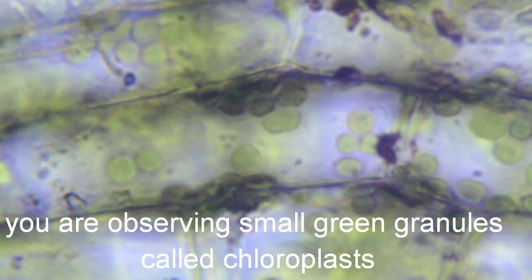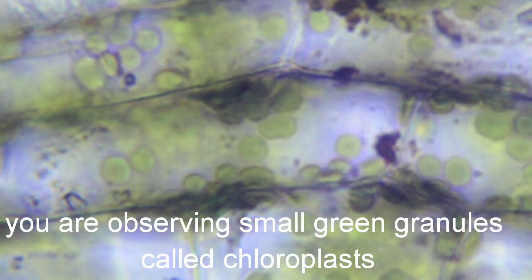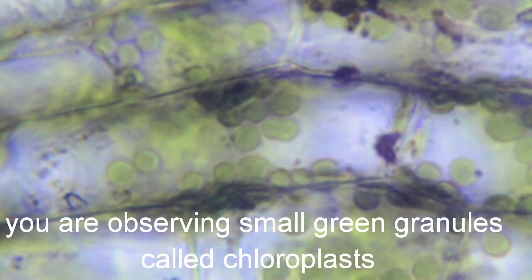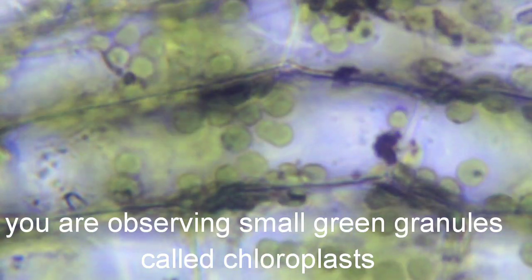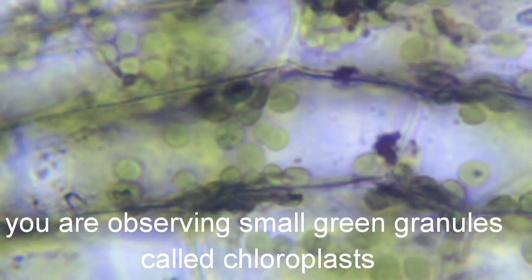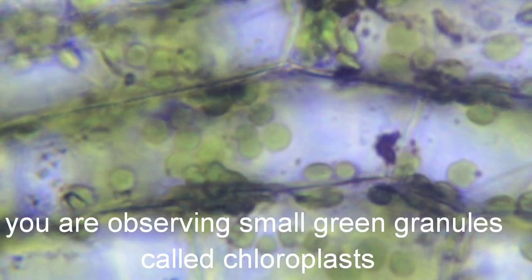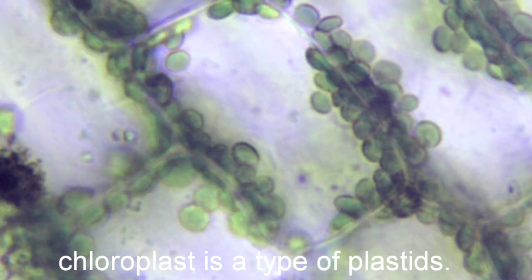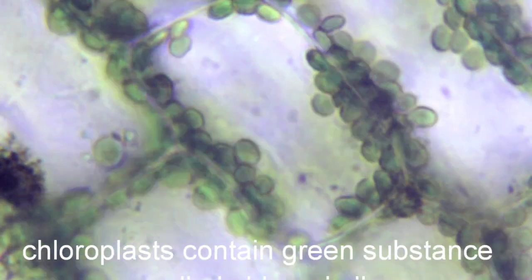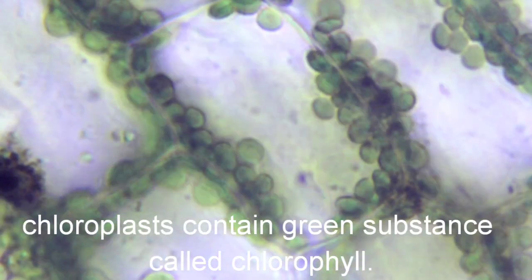Observe the free-moving chloroplasts in the cytoplasm around a big central vacuole in every cell. Chloroplasts are important plastids in plants. Chloroplasts contain a green substance called chlorophyll.